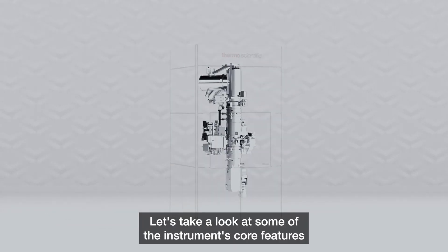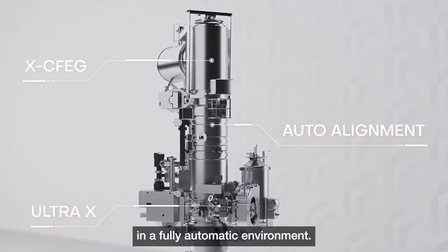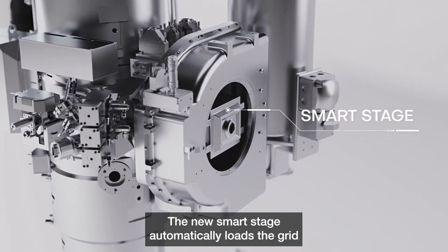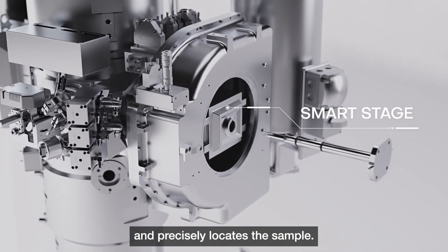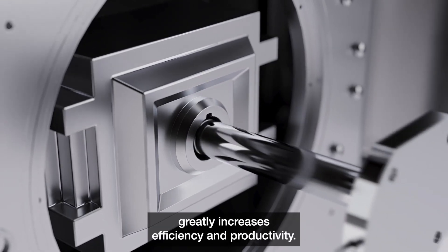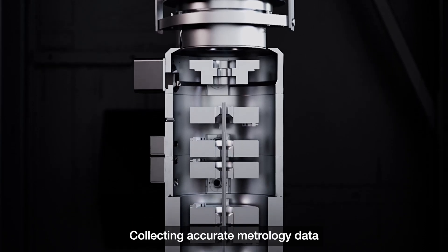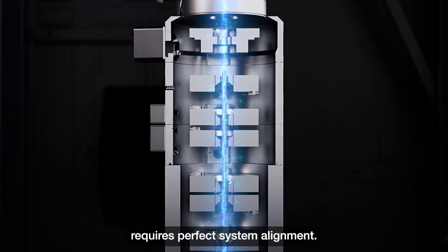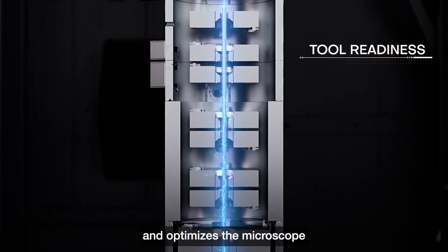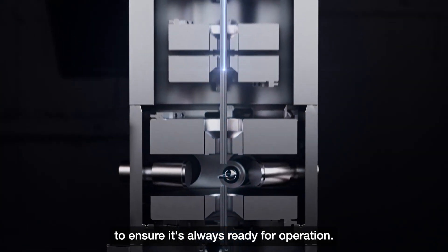Let's take a look at some of the instrument's core features and how it can deliver quality, high-volume metrology in a fully automatic environment. The new smart stage automatically loads the grid and precisely locates the sample. Automated sample loading and navigation greatly increases efficiency and productivity. Collecting accurate metrology data requires perfect system alignment.